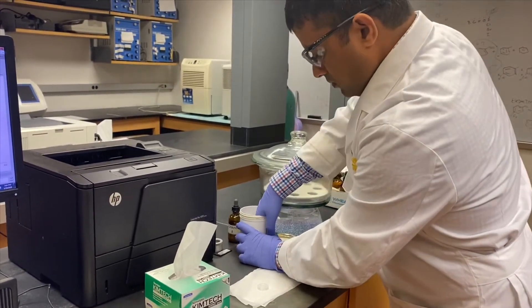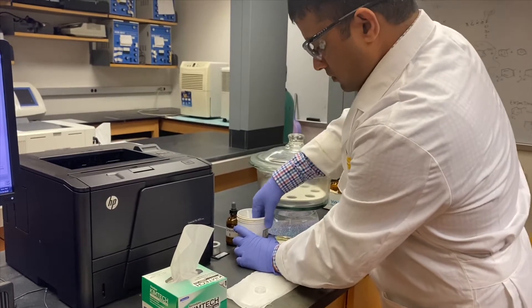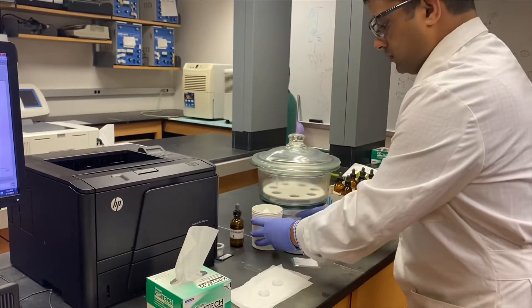As you saw, each plate needs to be placed in a separate pouch to avoid being scratched.